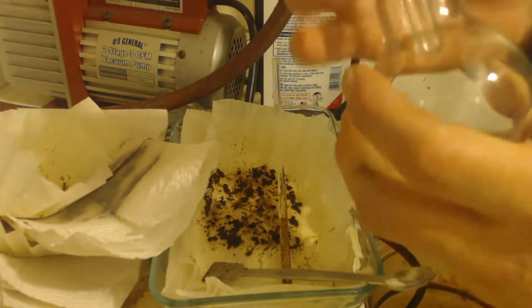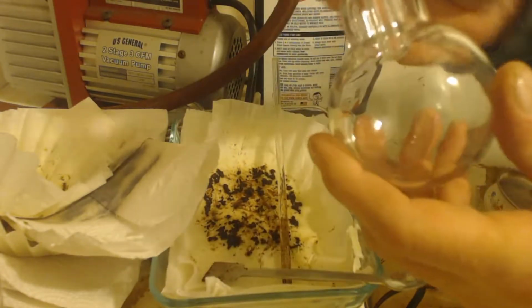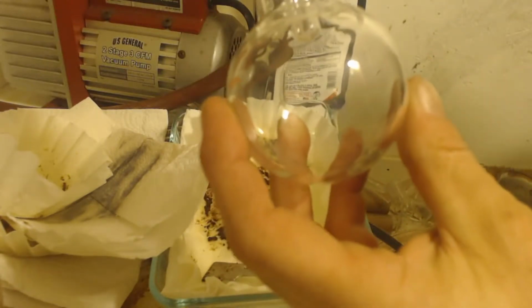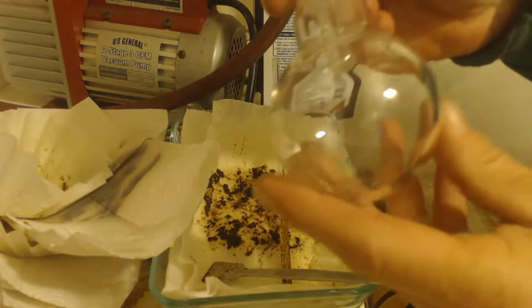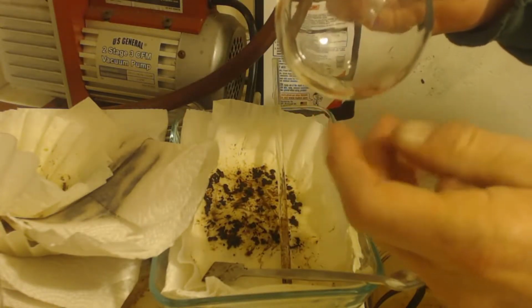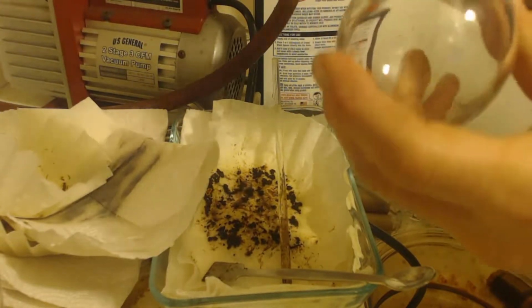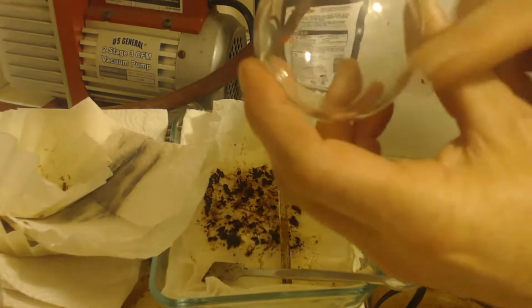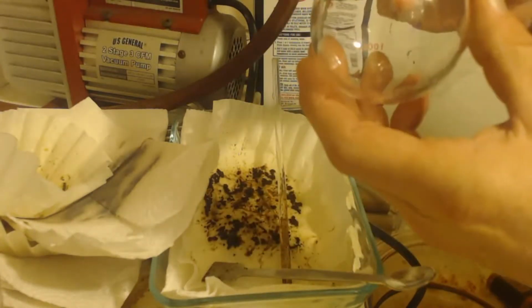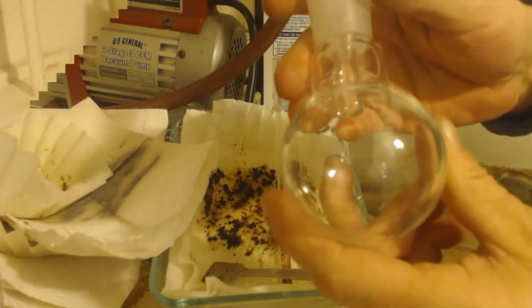And then I'll just store it like this because I just want to use this for Grignard reactions. So I only need like literally a grain of sand size particle for each reaction. So every time I need it, I just take it out of the freezer, let it heat up a little bit, and then heat it with a heat gun and get a little bit on there, and then I can throw that into the Grignard and put this cap back on and put it back in the freezer.